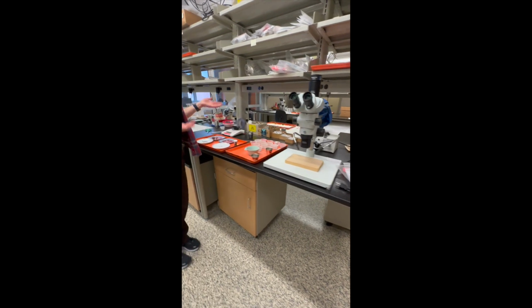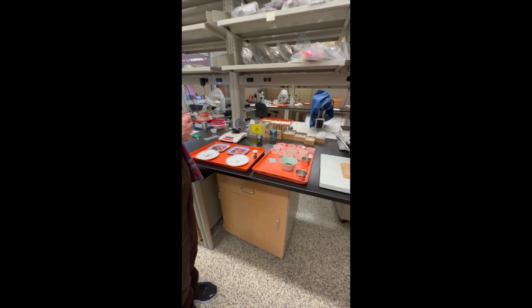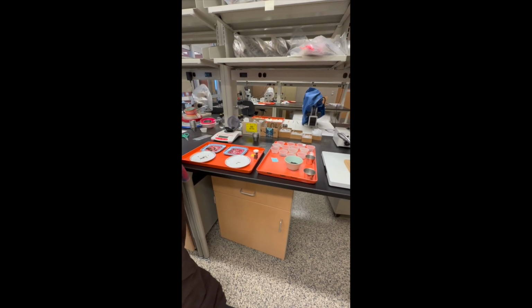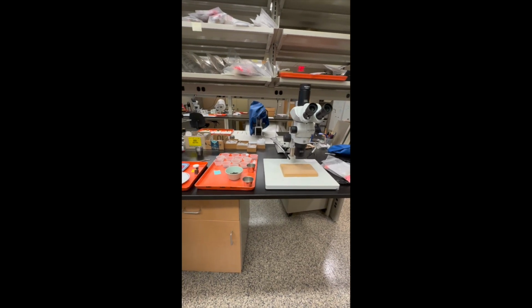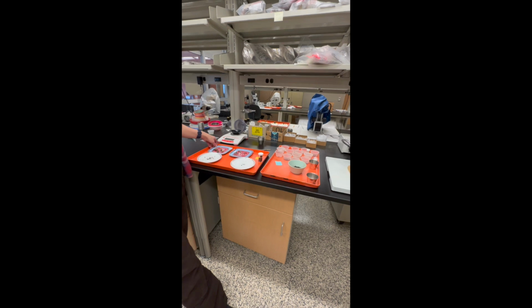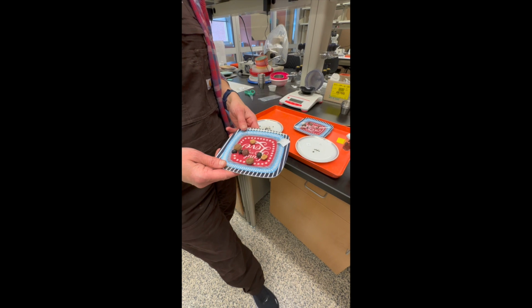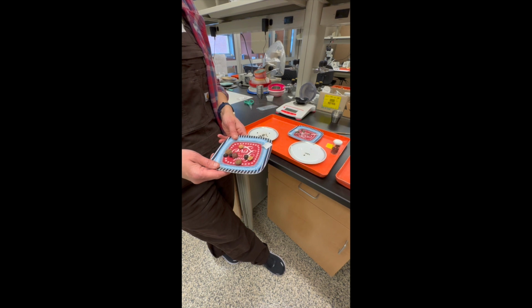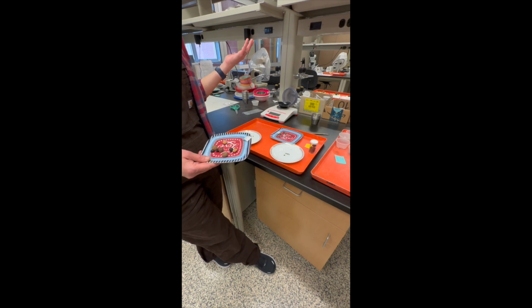Once they're dry, folks send them to us, and we put them through a set of geologic sieves to get them all roughly the same size. Then we look at them in the stereoscopic microscope and try to identify what they are. Are they wood, nuts, hickory nuts, acorn, corn, all sorts of different things. We have a lot of comparative materials, so modern plants and bits that we collect and then carbonize and break into little pieces so that we know what they look like when they're burnt and broken, because that's how we find them from archaeological sites.